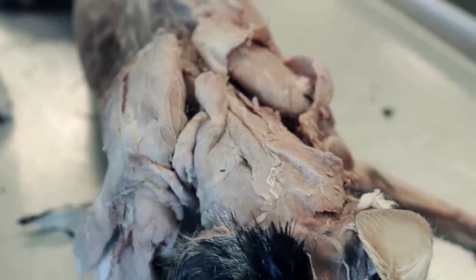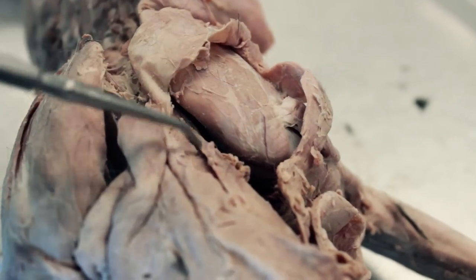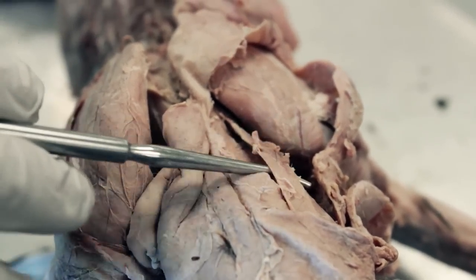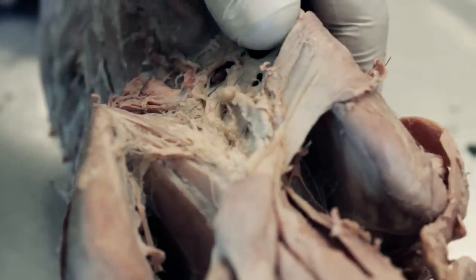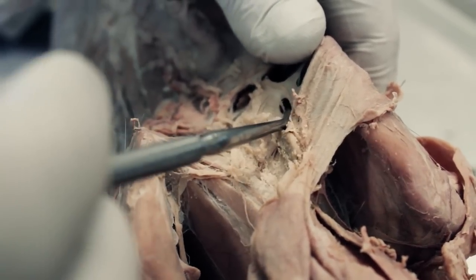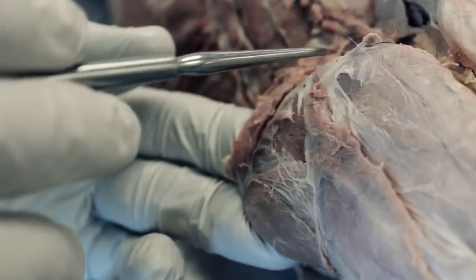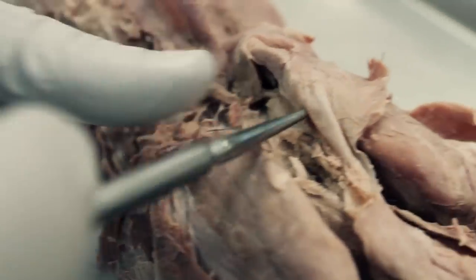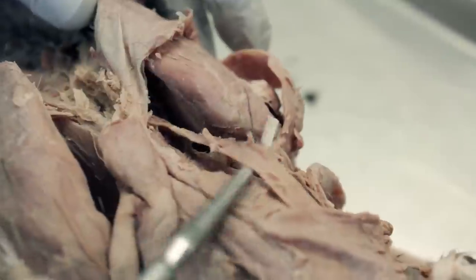What we want to do right now is review the three rhomboideus muscles. On the neck area, extending from the shoulder blade up to the back of the head is rhomboideus capitis — 'capitis' means head, that's how we can remember it. Between the shoulder blades, if I pull them apart, you can see this big band, which is the rhomboideus minor. The last rhomboideus is on the corner of the scapula, which links up to the rhomboideus minor, called the rhomboideus major. So: rhomboideus major, rhomboideus minor between the scapula, and rhomboideus capitis by the neck.